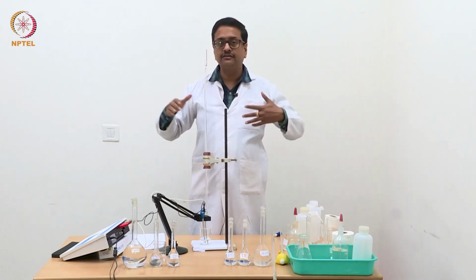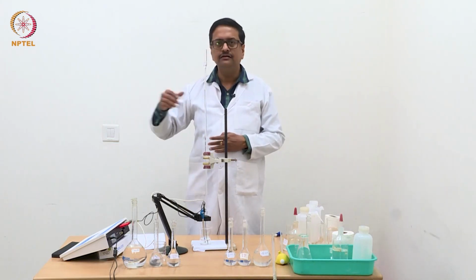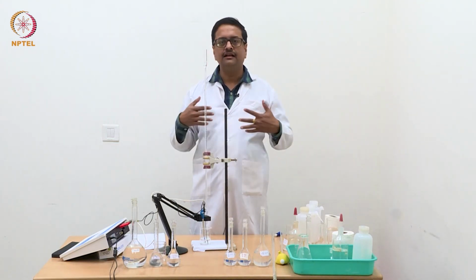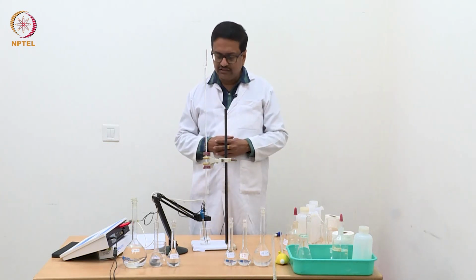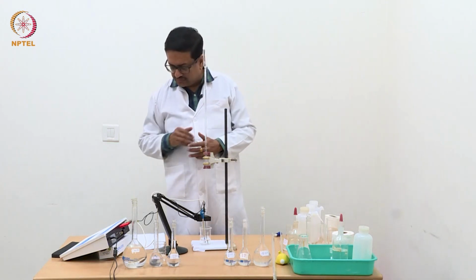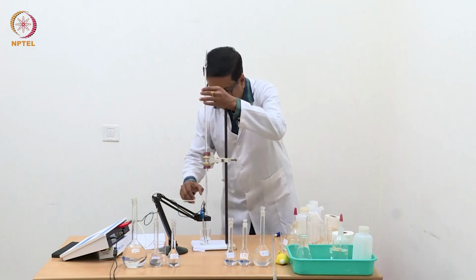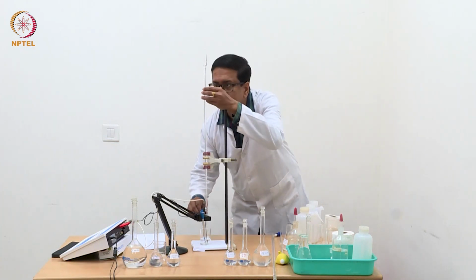So when the hydrolysis of ammonium chloride ends and the reaction is over, there is no H plus ion present in the solution, then with addition of more and more NaOH, we will see a constant increase in conductance. So let us continue addition as usual.